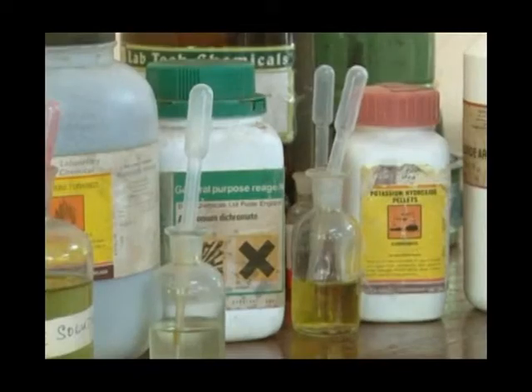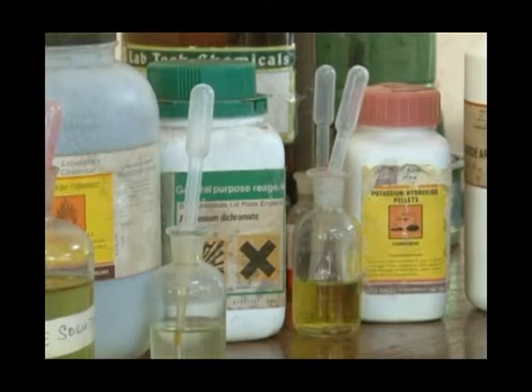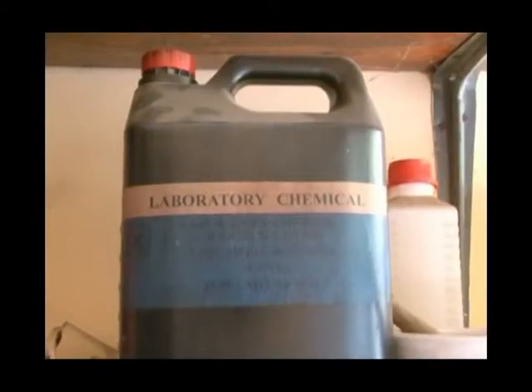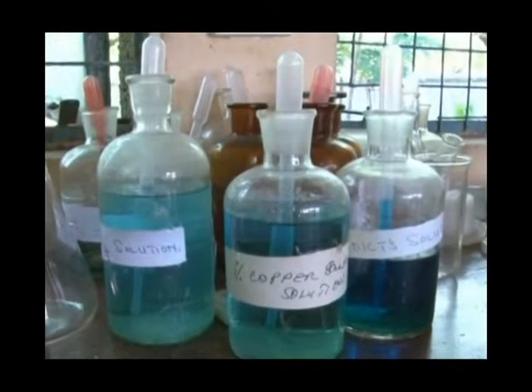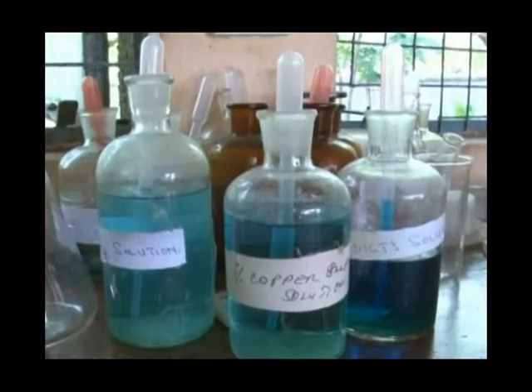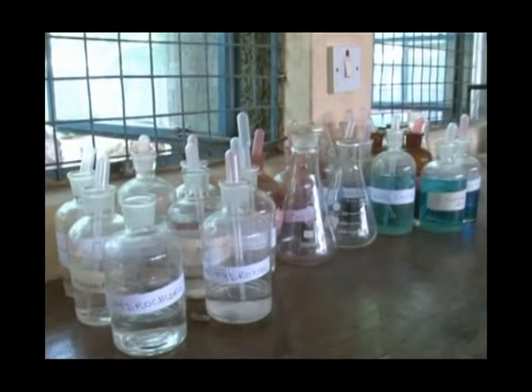Remember that in a biology laboratory one often works with strong chemicals. These chemicals are extremely harmful to humans, especially when swallowed, inhaled, or when they get onto your skin. The labels on containers with chemicals tell us what they contain and warn us about what is harmful about those particular chemicals.